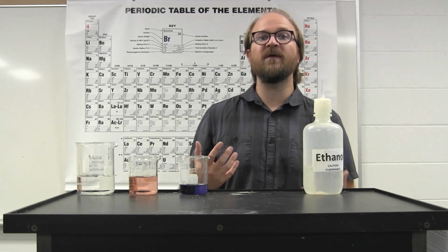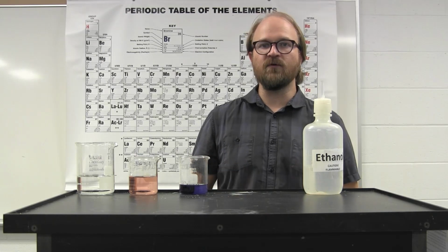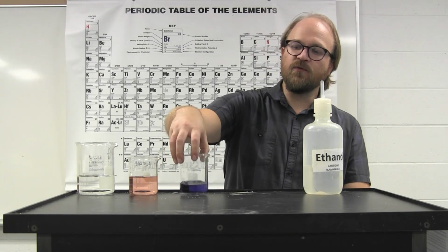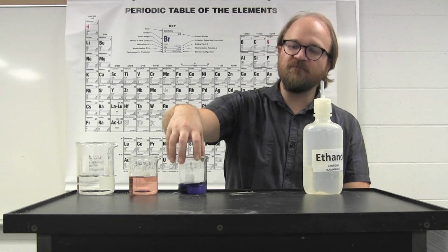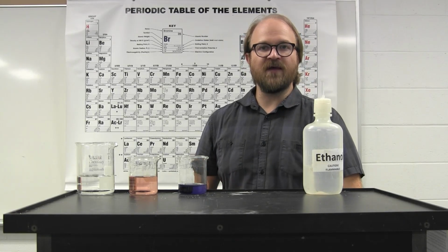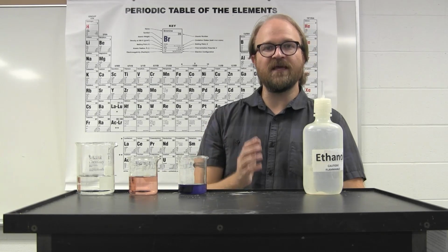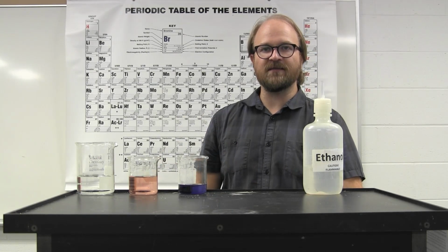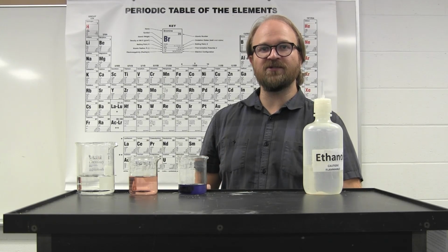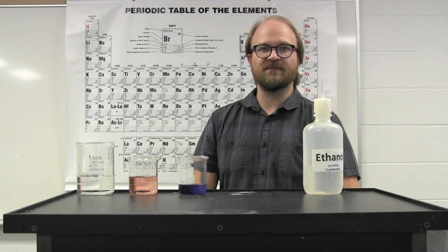There are 2 competing molecules and complexes in equilibrium with each other. When these are combined, you get the color scheme of both of them. Using a spectrophotometer, you could obtain the absorbance at each of these different wavelengths and correlate that to a specific concentration of both of the complexes.